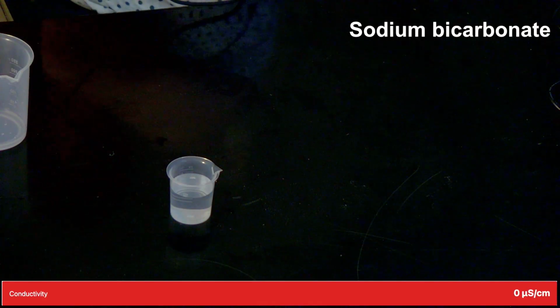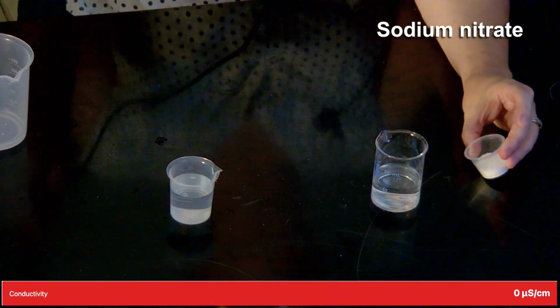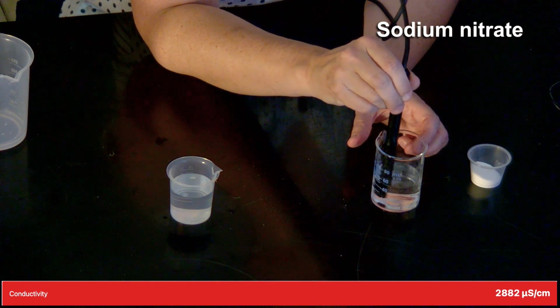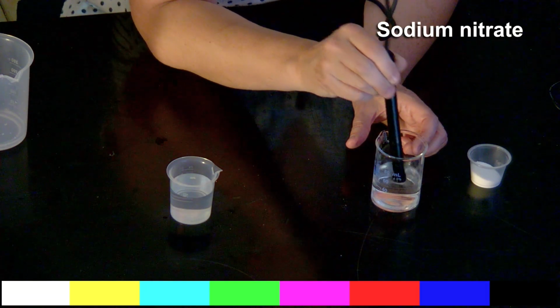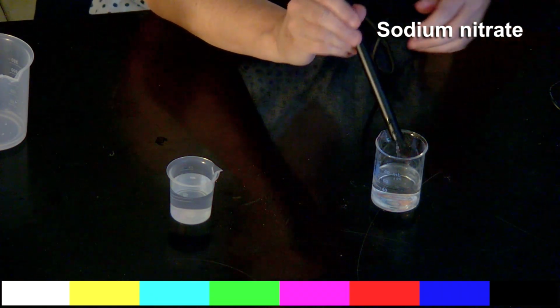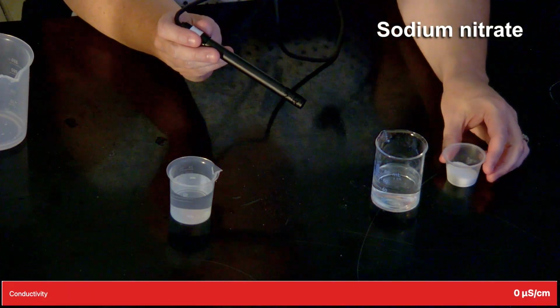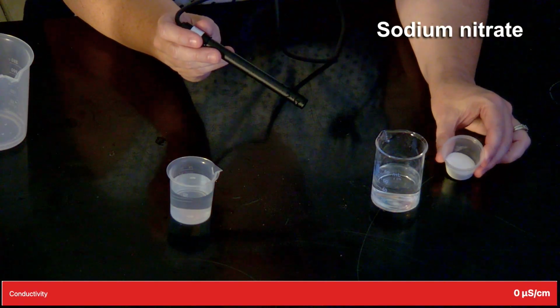The next substance is sodium nitrate, white powder, a little bit granular. We'll have to do that one again. My next substance is sodium nitrate, also a white solid, a little bit more granular.